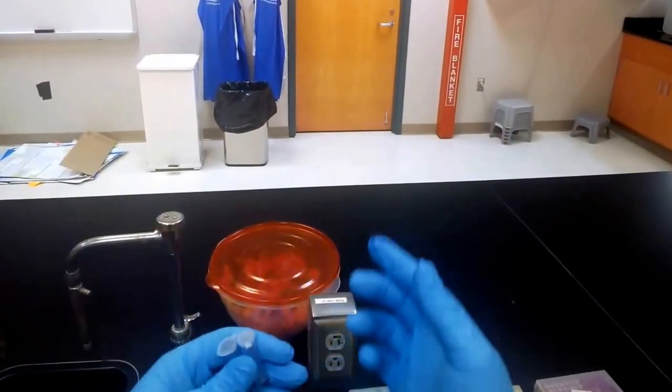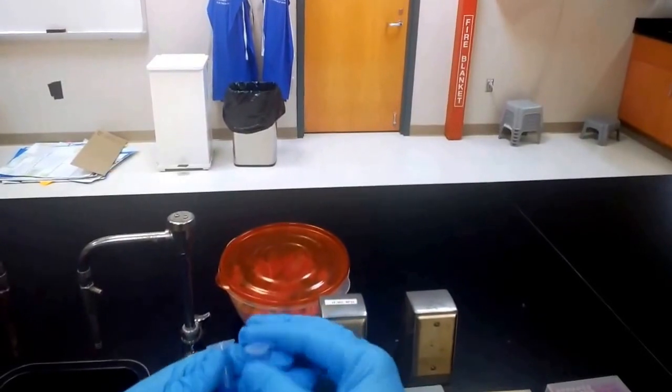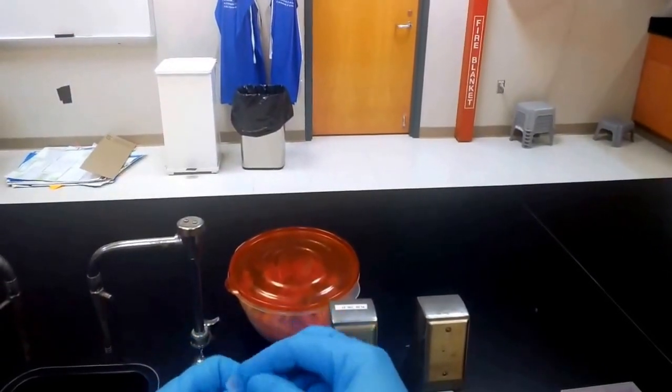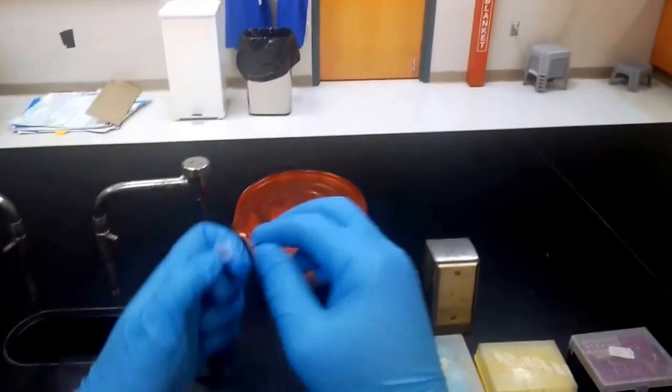Now one useful skill is to be able to open and close a microcentrifuge tube with the hand that you are not pipetting with. So let's try that.